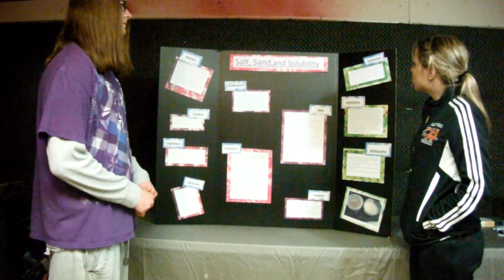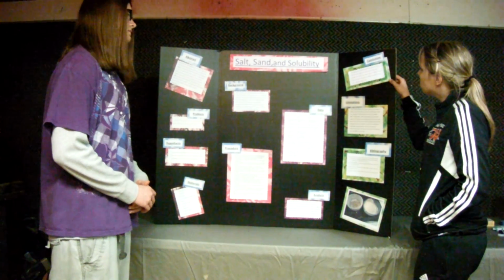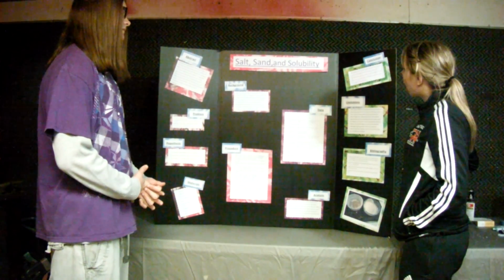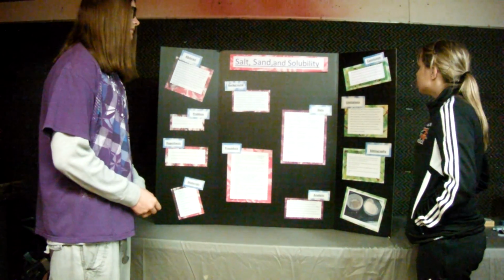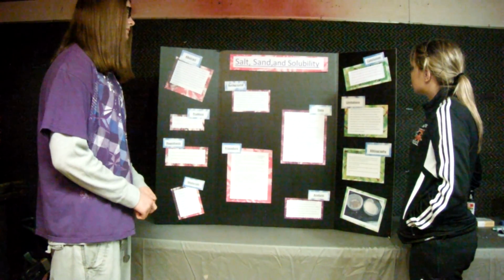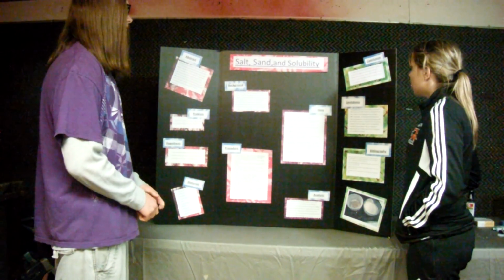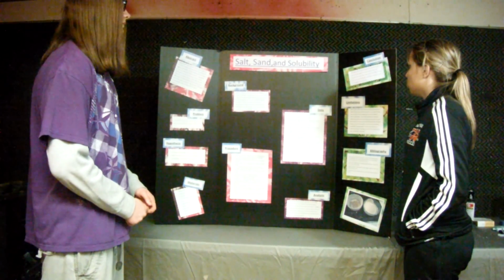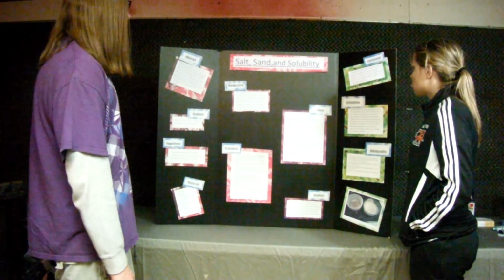Conclusion. We rejected our original hypothesis because if we start with 100 grams of salt and 100 grams of sand, we should still end up with 100 grams of salt and 100 grams of sand after the experiment. But we ended up with less salt than what we started with.